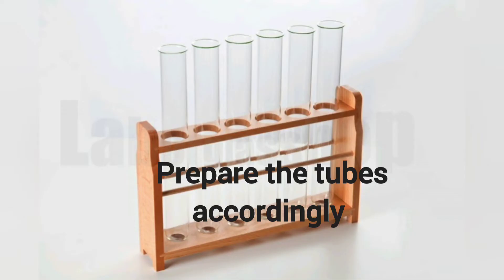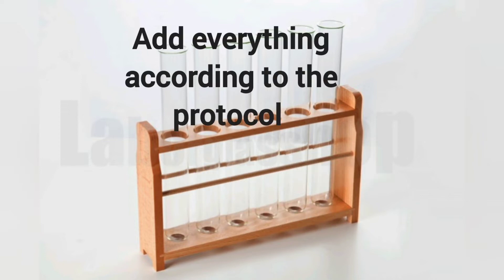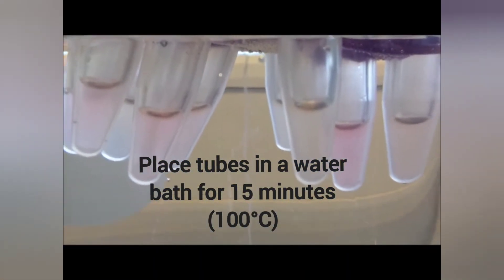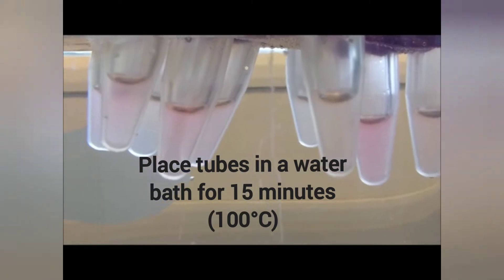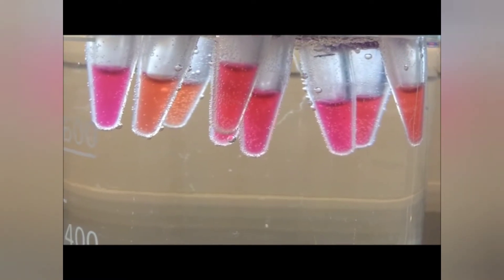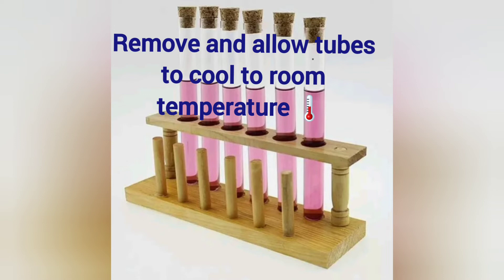Now TBARS. Prepare the tubes accordingly, add everything according to the protocol, place tubes in the water bath for 15 minutes. 15 minutes later — done. Remove and allow all tubes to cool to room temperature.